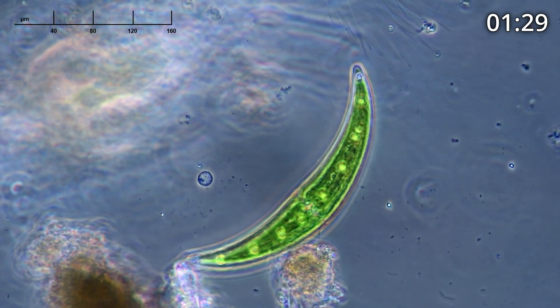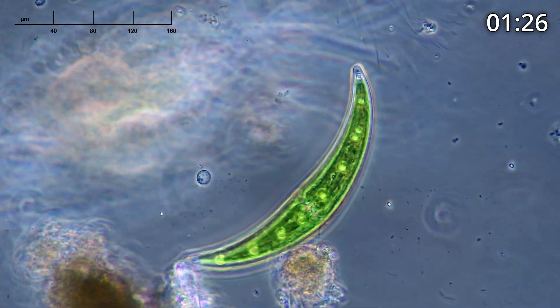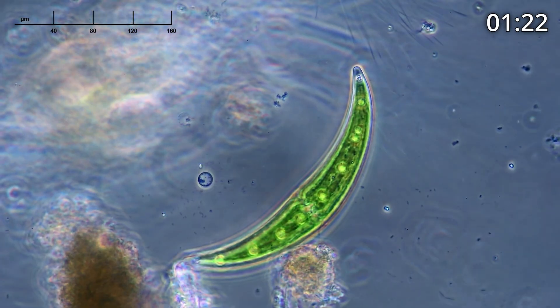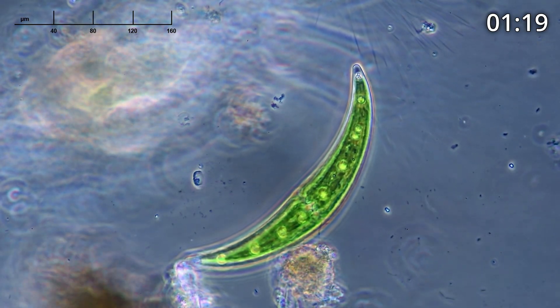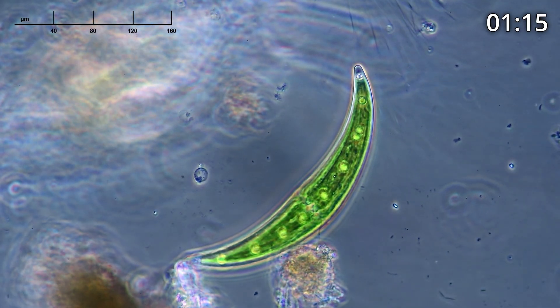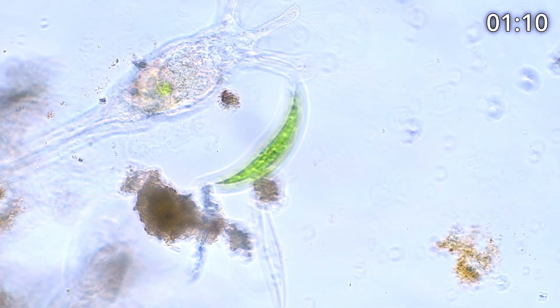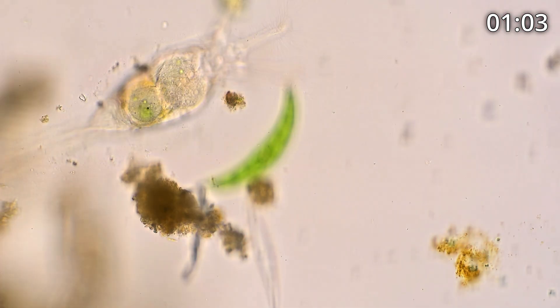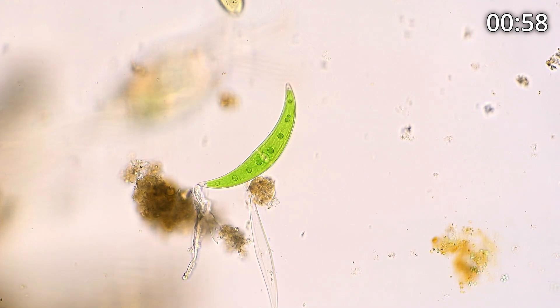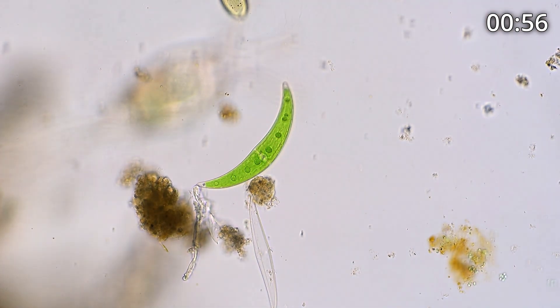Here we switched focus to a Closterium, which is a desmid alga. These things are great. If you look at the top tip you see those little white things moving around, dancing around — those are barium sulfate crystals. Scientists have absolutely no idea what the purpose of these crystals is. We just know that the Closterium absorbs barium out of the water column and, already containing sulfate, creates barium sulfate crystals. These desmids are absolutely gorgeous.